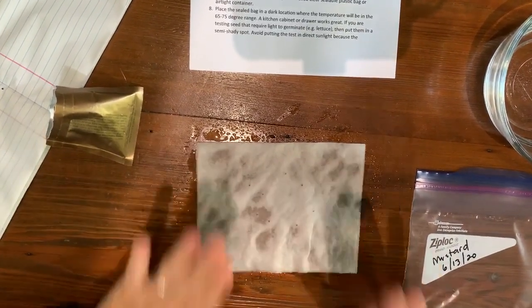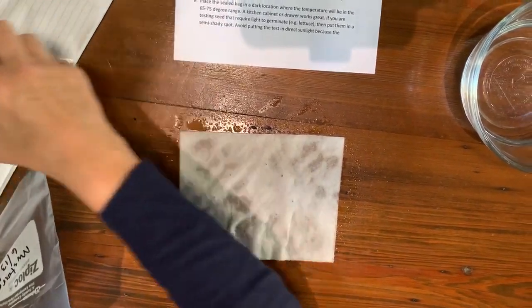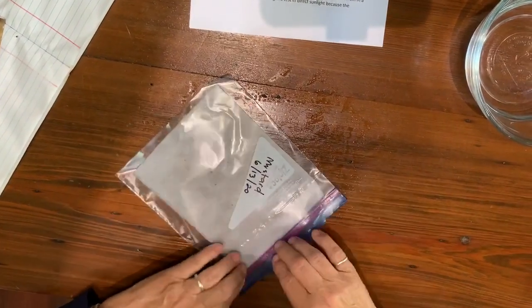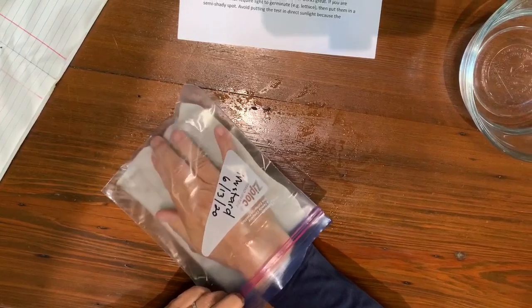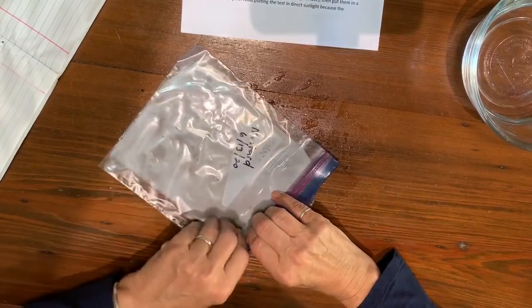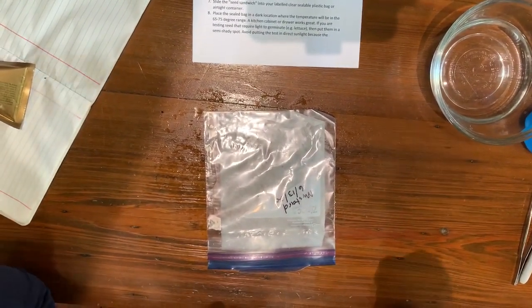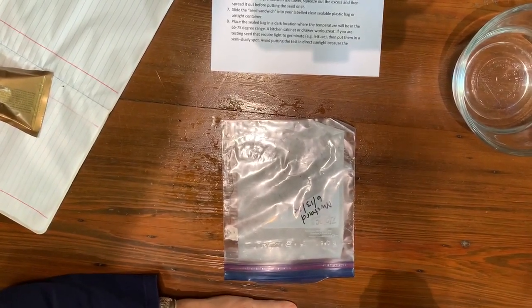I'm going to slide this into a quart freezer bag. Get it into the bag, push as much air out as I can, then zip lock it. Now I've got my seeds moistened on a paper towel in my plastic bag. Number eight says to place the sealed bag in a dark location, about 65 to 75 degrees — that's the range of most people's homes. You can put it in a kitchen cabinet or a drawer, but be sure to set a reminder on your phone so you don't forget about it.